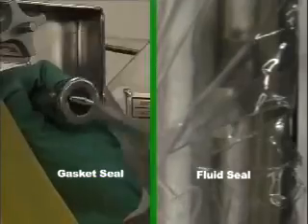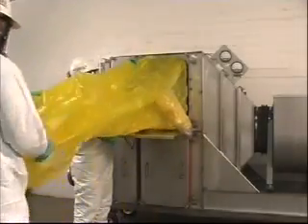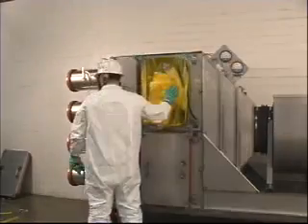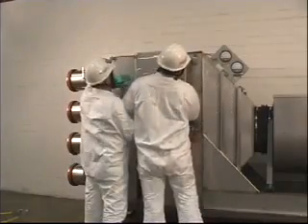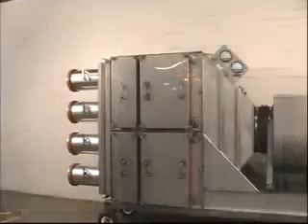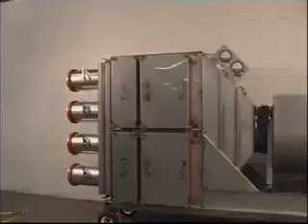Seal the filter by closing the locking mechanism. Extend the bag out completely. Fold and roll the bag toward the housing until the bag is tucked neatly between the bagging ring and the filter access port. While holding the change-out bag in this position, replace the housing access door carefully. Tighten the doorknobs alternately by turning clockwise until the door is sealed against the housing. The filtration system is now ready for operation. Open upstream and downstream dampers and restart the system or redirect bypassed airflow through the system.